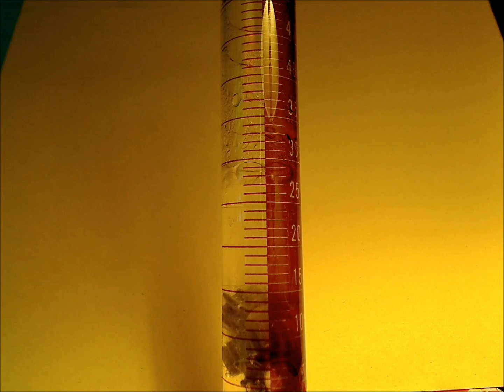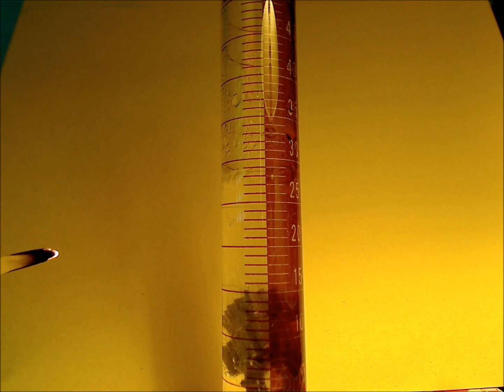So this is a nice demonstration. You can do it with 3% hydrogen peroxide, but it works better with the 6%. And as I said, it's 20 volume hydrogen peroxide that can be obtained from any beauty supply store.